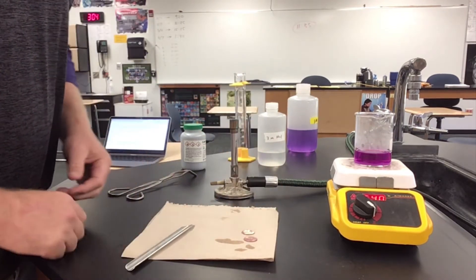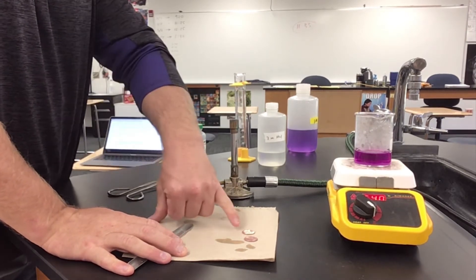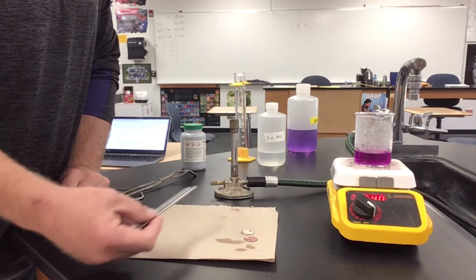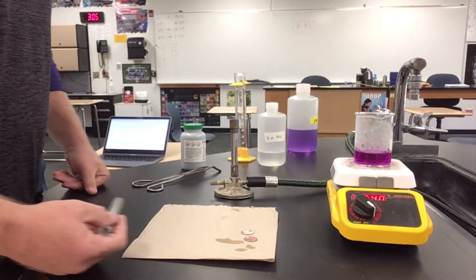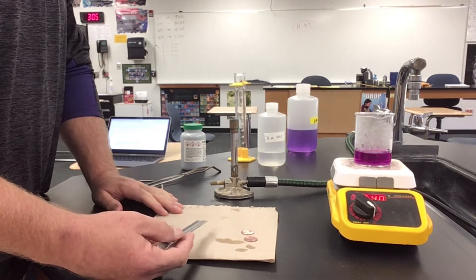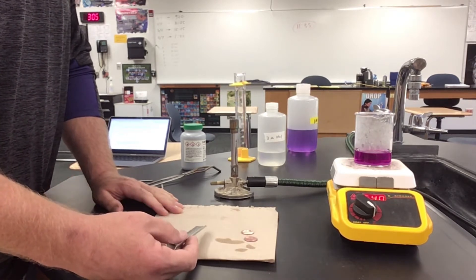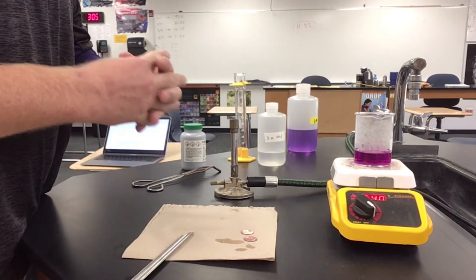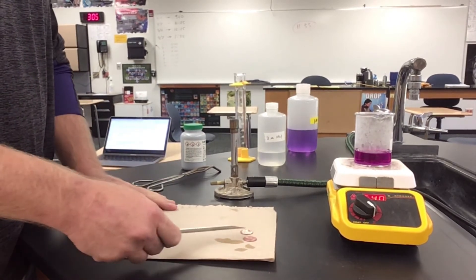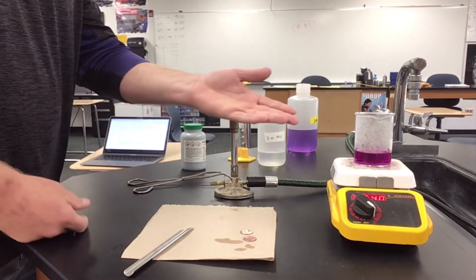These pennies are from the late 1990s and early 2000s, and they make really good pennies for this experiment. The inside core of these pennies is actually zinc — only the outer layer, about three percent, is actually copper. The ultimate goal of this lab is to turn the outer layer into brass. We have a zinc inner core and a copper layer, and we're going to put another layer of zinc on the outside. That creates a good environment for those two things to melt together when we create the brass alloy between the zinc and the copper. It does work with older pennies too, but it tends to work better with newer pennies.